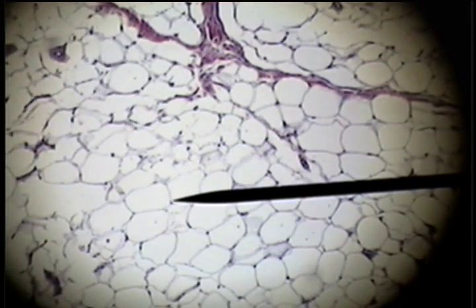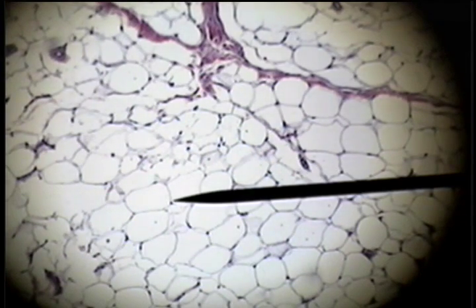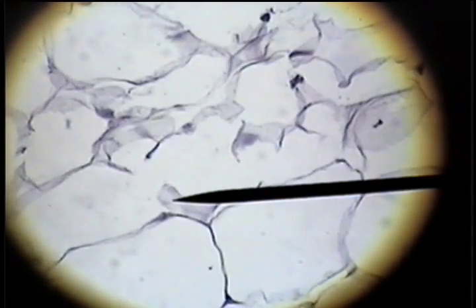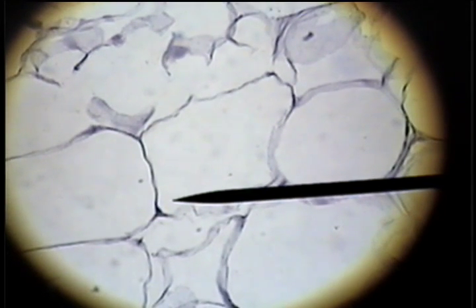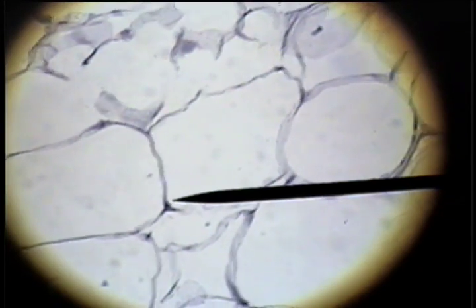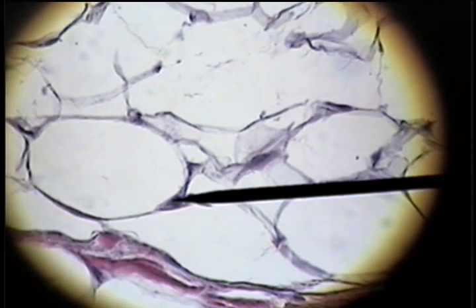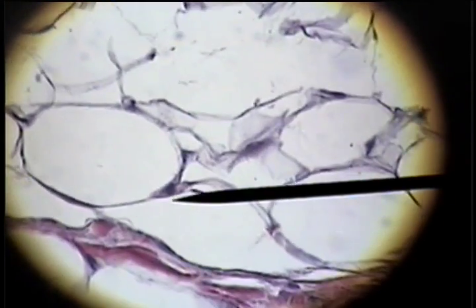The nuclei and organelles are pushed over to one corner by the oil or lipid drop that fills this cytoplasmic membrane. And again, if we look at the adipose cell on high power, here's the nucleus, and all the organelles are pushed over to one side of the cell. This is adipose connective tissue. The individual cell is called an adipocyte, and the tissue collectively is called adipose tissue.